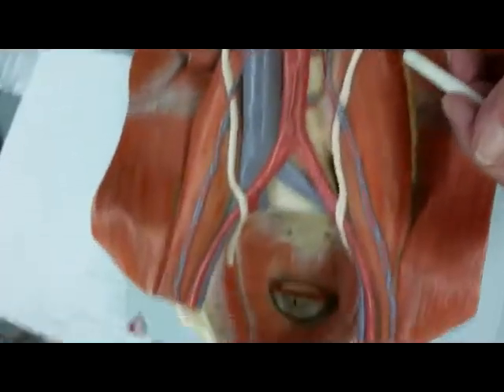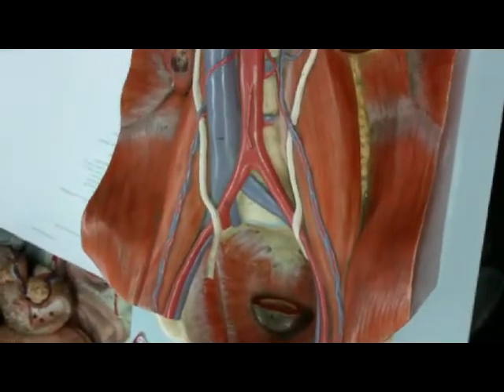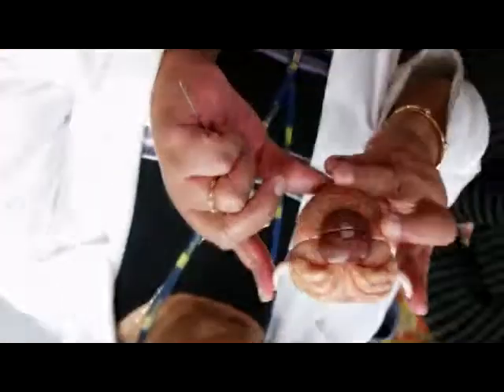And these 2 tubes now that are leaving the kidney, what are they? Those are the ureters. 2 ureters leaving the kidney. And it empties where? Into the urinary bladder. And look very carefully now. These are the end of the 2 ureters. It fits down in there. The 2 ureters. And this would be the urinary bladder.